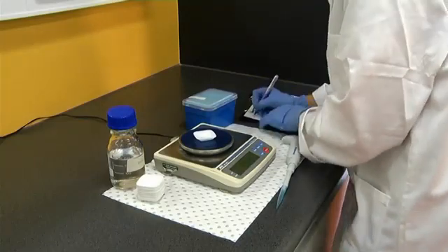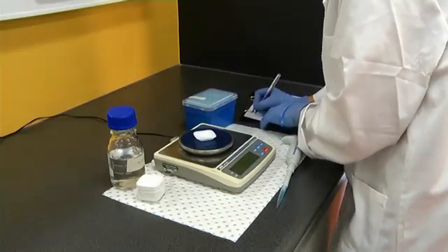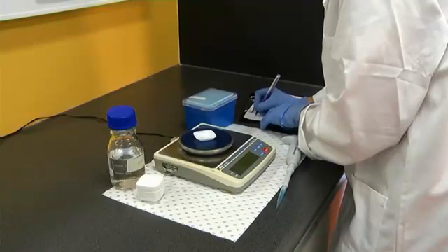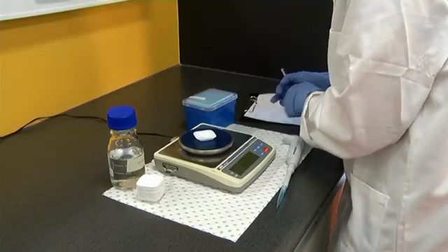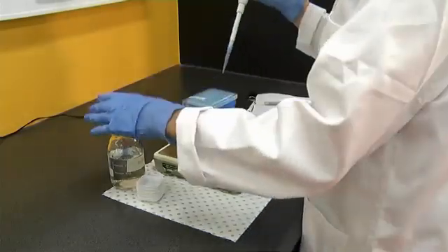The average will give you an estimate of the accuracy of your pipetting. The standard deviation will indicate the level of precision. Repeat this procedure for the maximum and minimum volumes for each pipet that you use.